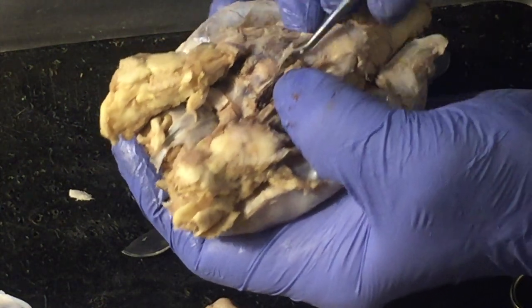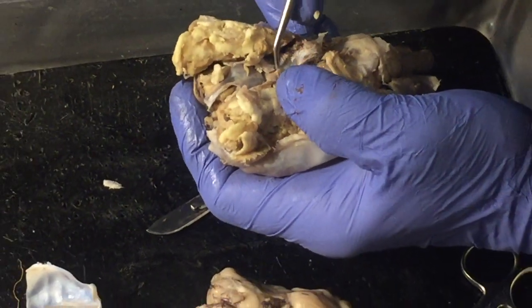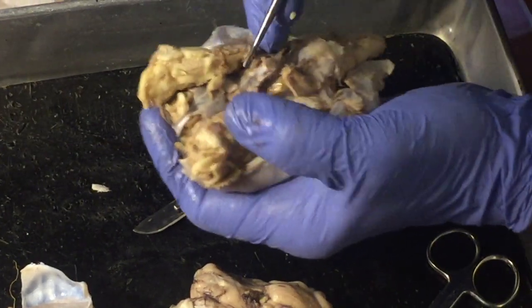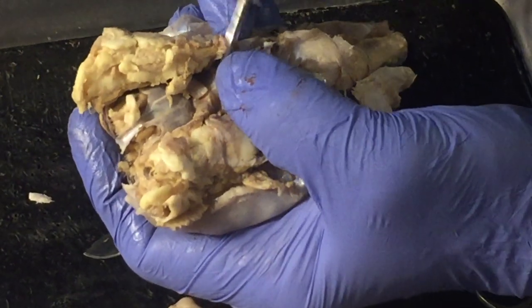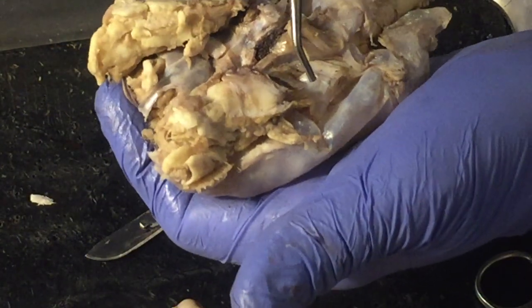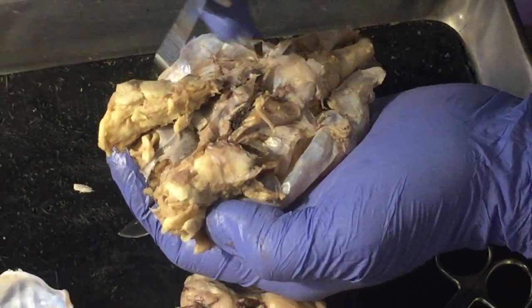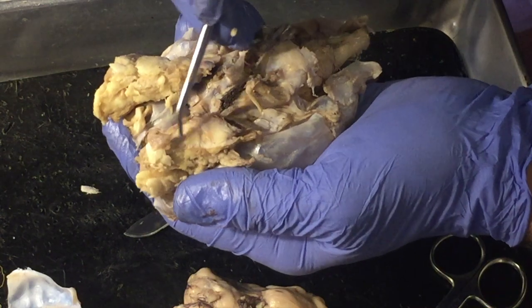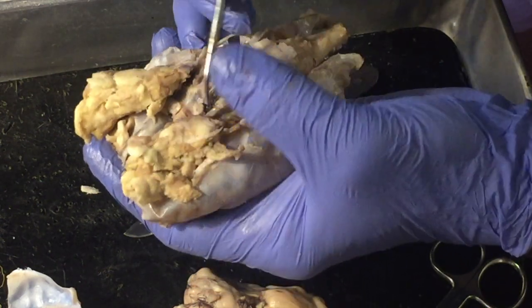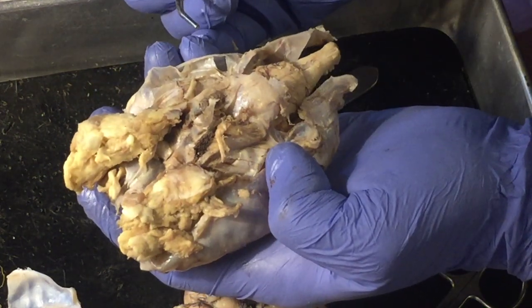And if I take this, I don't know if I can get this apart or not, probably not, without tearing it even more. You can see that they cross over, so that normally what you do with your right side is controlled by the left side of your brain and vice versa. But the eyes are a little different. What you see with your right eye, this would be the sheep's right eye, goes to both sides of the brain. What you see with your left eye goes to both sides of the brain.